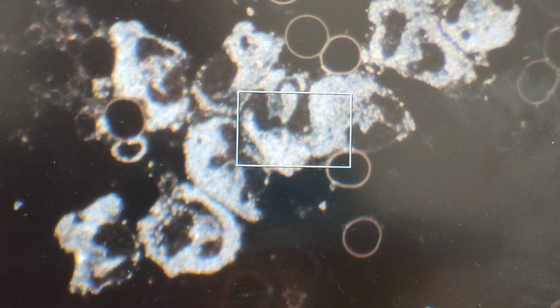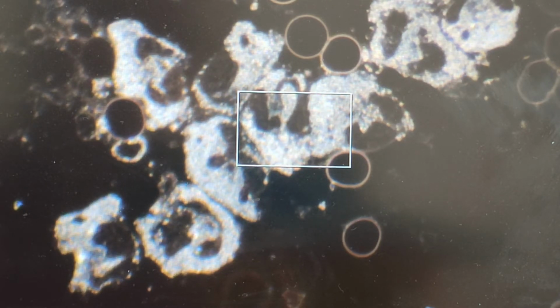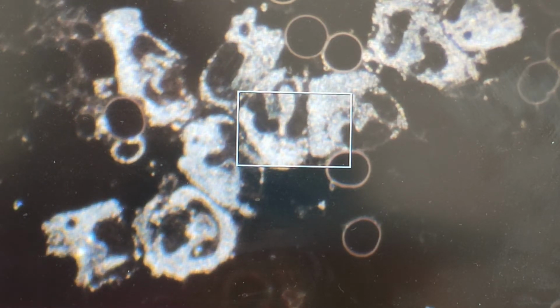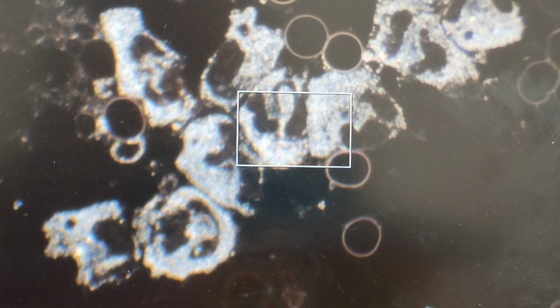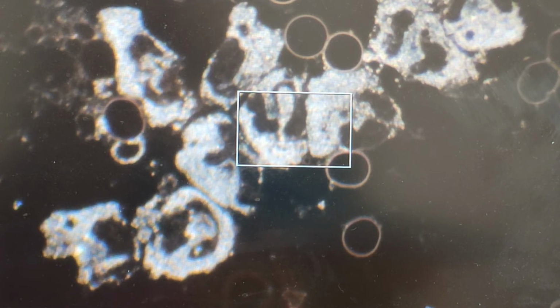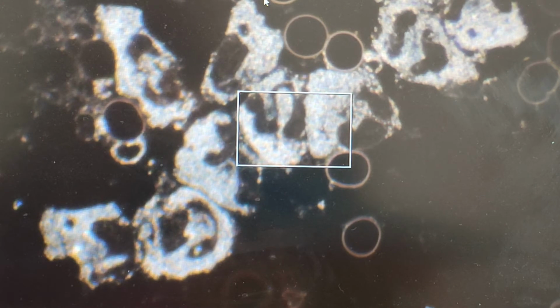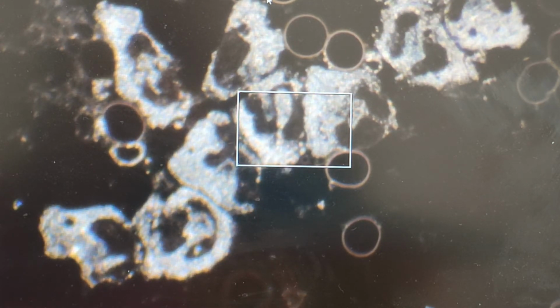it's engulfed, and that's what these white shiny granules that you can see moving do. They're full of enzymes and hydrogen peroxide and things like that, so bleach. They literally do dissolve whatever it is that they engulf, because that's how they clean up the trash. You can actually see, I'm going to put my arrow here, there's some bit of trash here where that arrow is. Can you see it?